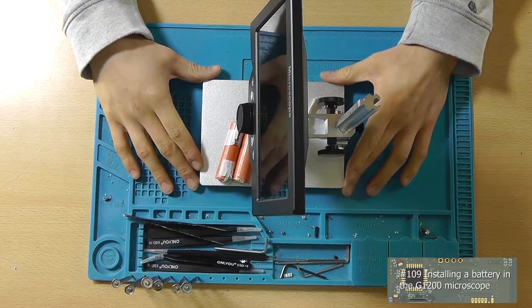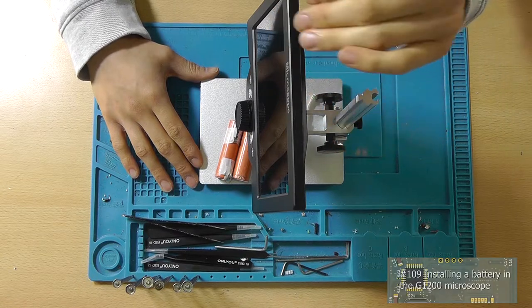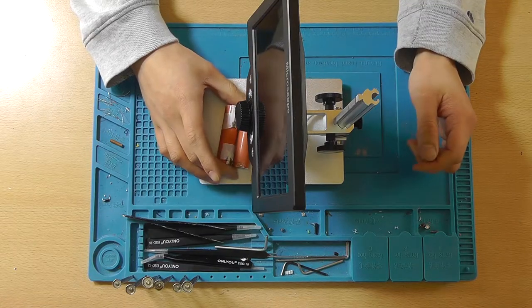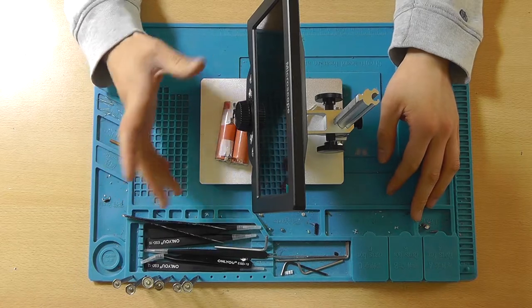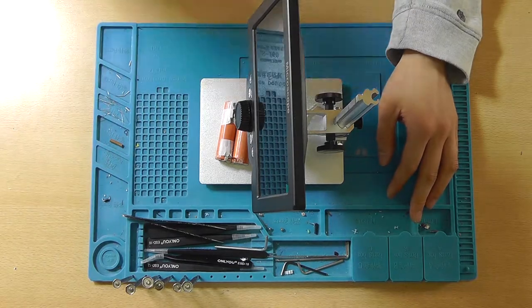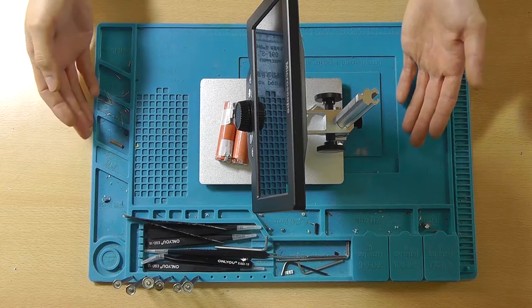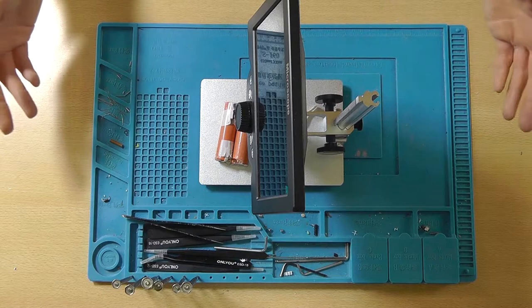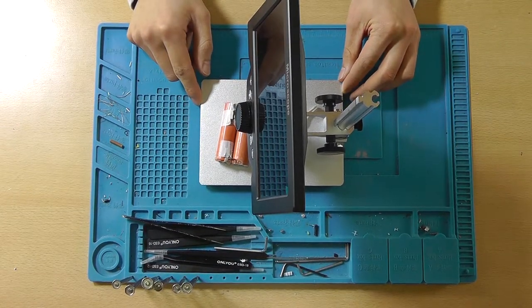Now we've got the microscope on the desk, and that's not because we're going to take a look through the microscope. We're actually going to upgrade the microscope. Now, as I said in the microscope review video and the unboxing video, this was the model that didn't have any batteries installed. And why did I pick that model? Well, because I thought I don't need to be out in the field and access the microscope and view through it on electronics. I'm always at the lab when I need the microscope. So there was no need for a battery.